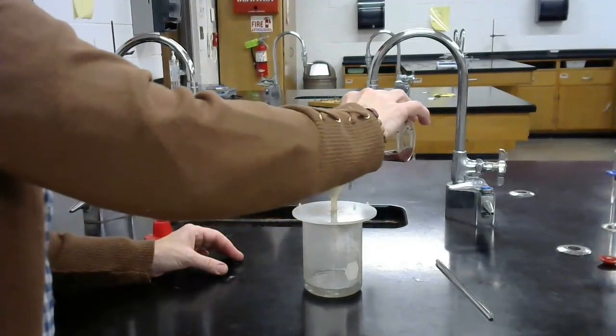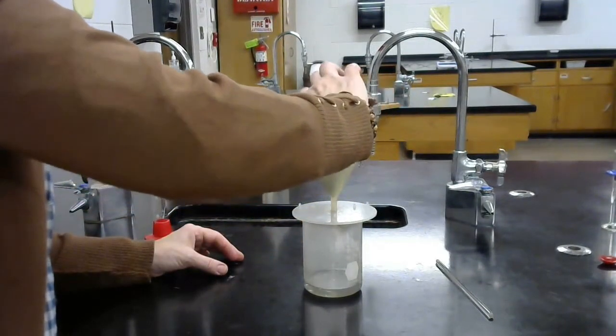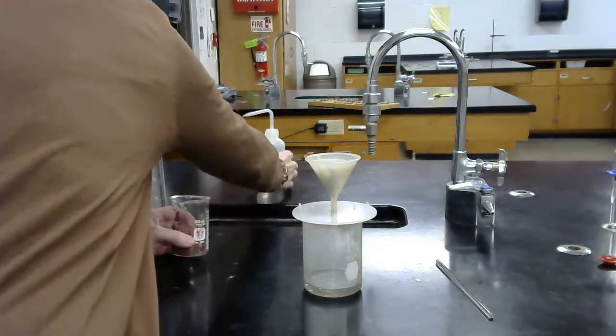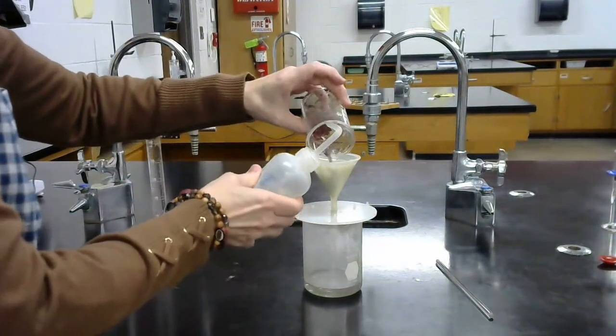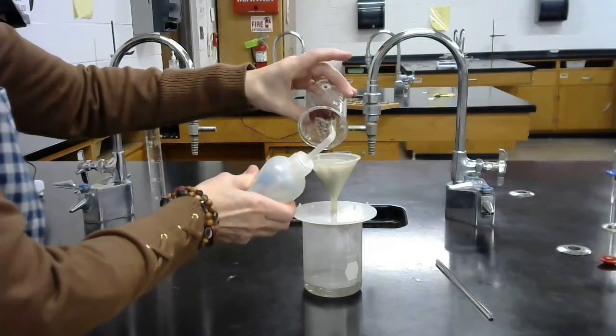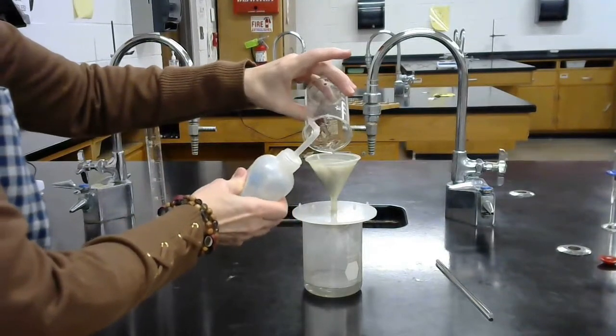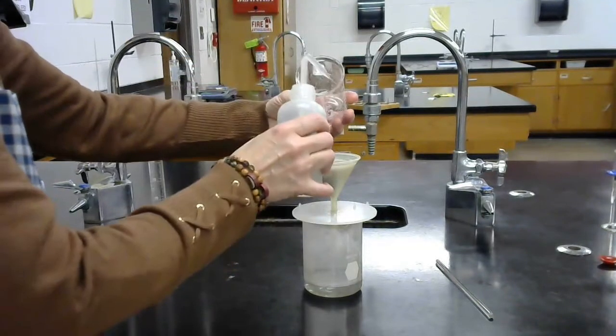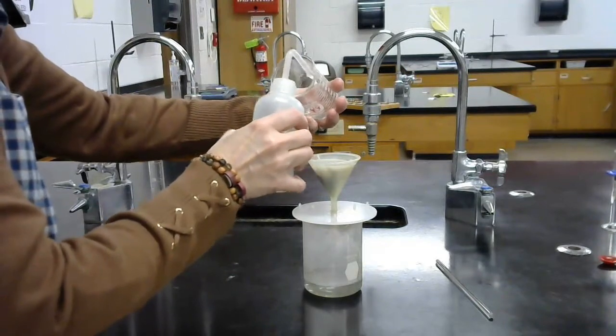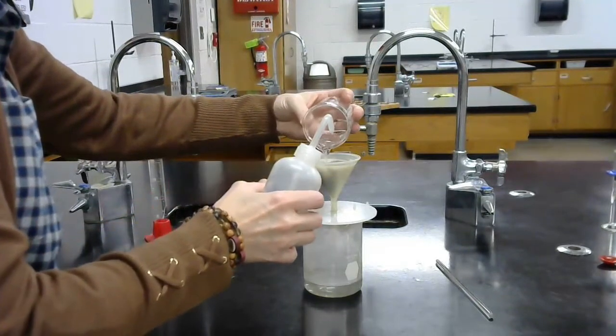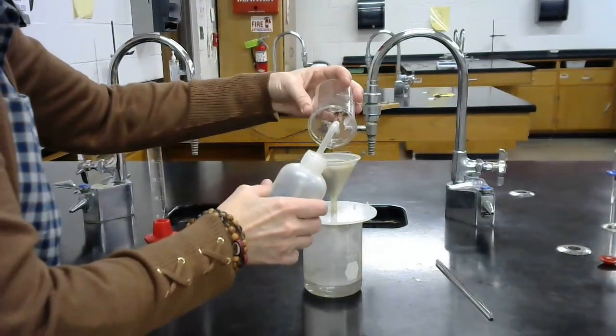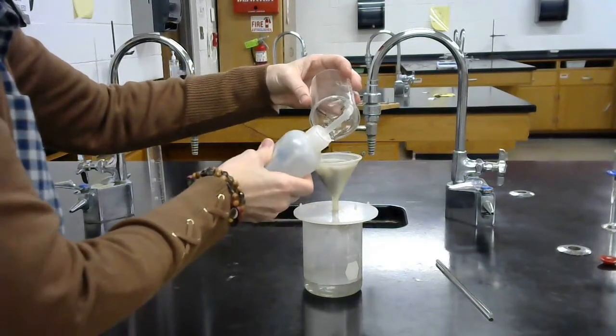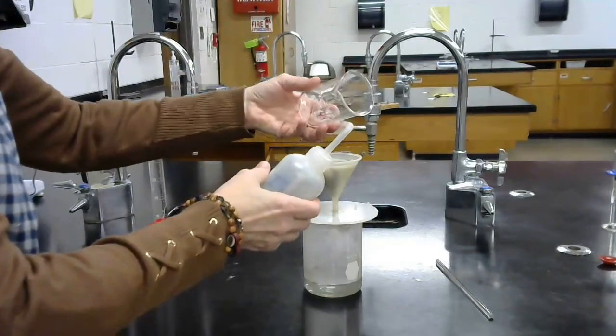So we'll just need to keep filtering this. Bring all that precipitate out. Looks like we're getting our beaker pretty clean.